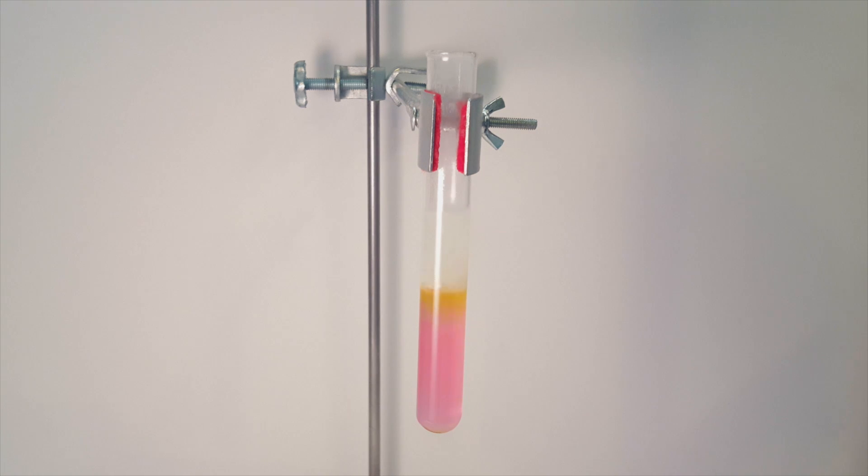My guess would be that by agitating the solution, I actually managed to get a small amount of water suspended or dissolved in the gasoline. Even though this would be an incredibly small amount of water actually dissolved, the ethanol component likely could have kept it in solution or at least suspended. So the result of this mistake, the sodium did nothing for the rest of this trial but float around and react with the water in the new gasoline solution.